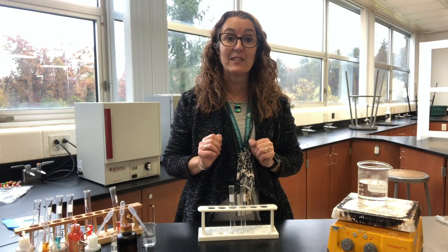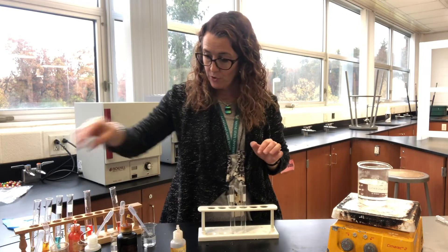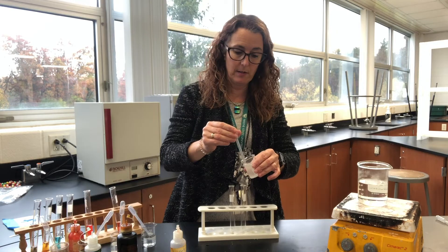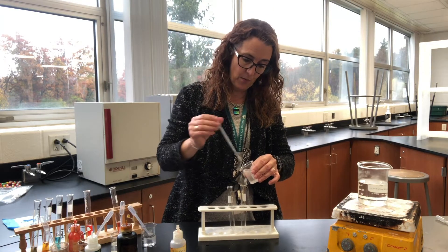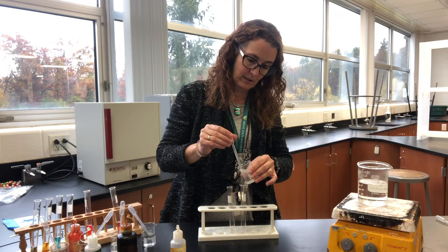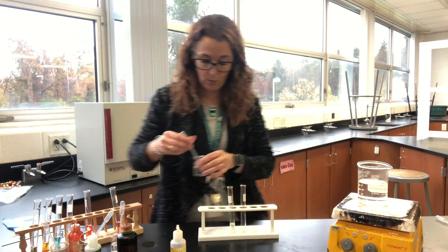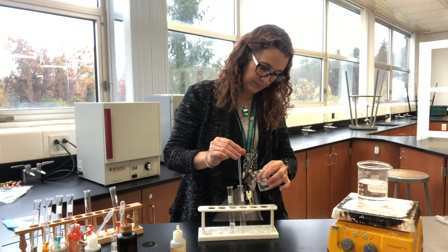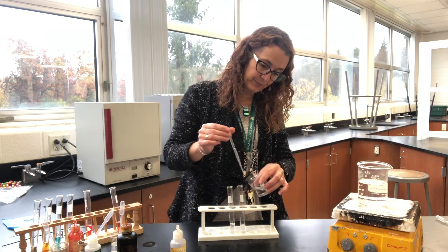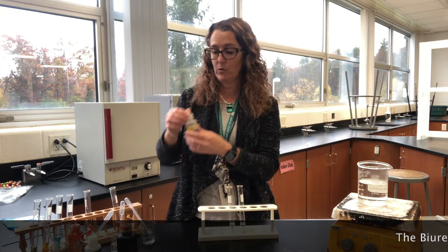Our final test is for proteins and we use a solution called biuret. Here is our protein solution — I'll give it a stir and put some squeezes into my test tube, and some water into our control, so they're about equal.